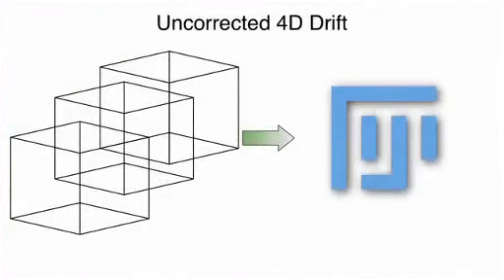To correct for sample drift, we have developed a plugin to utilize the open-source image processing platform Fiji. Our Correct 3D Drift plugin is able to perform phase correlation registration to correct for movement that occurs as a result of sample drift in three-dimensional time-lapse experiments.